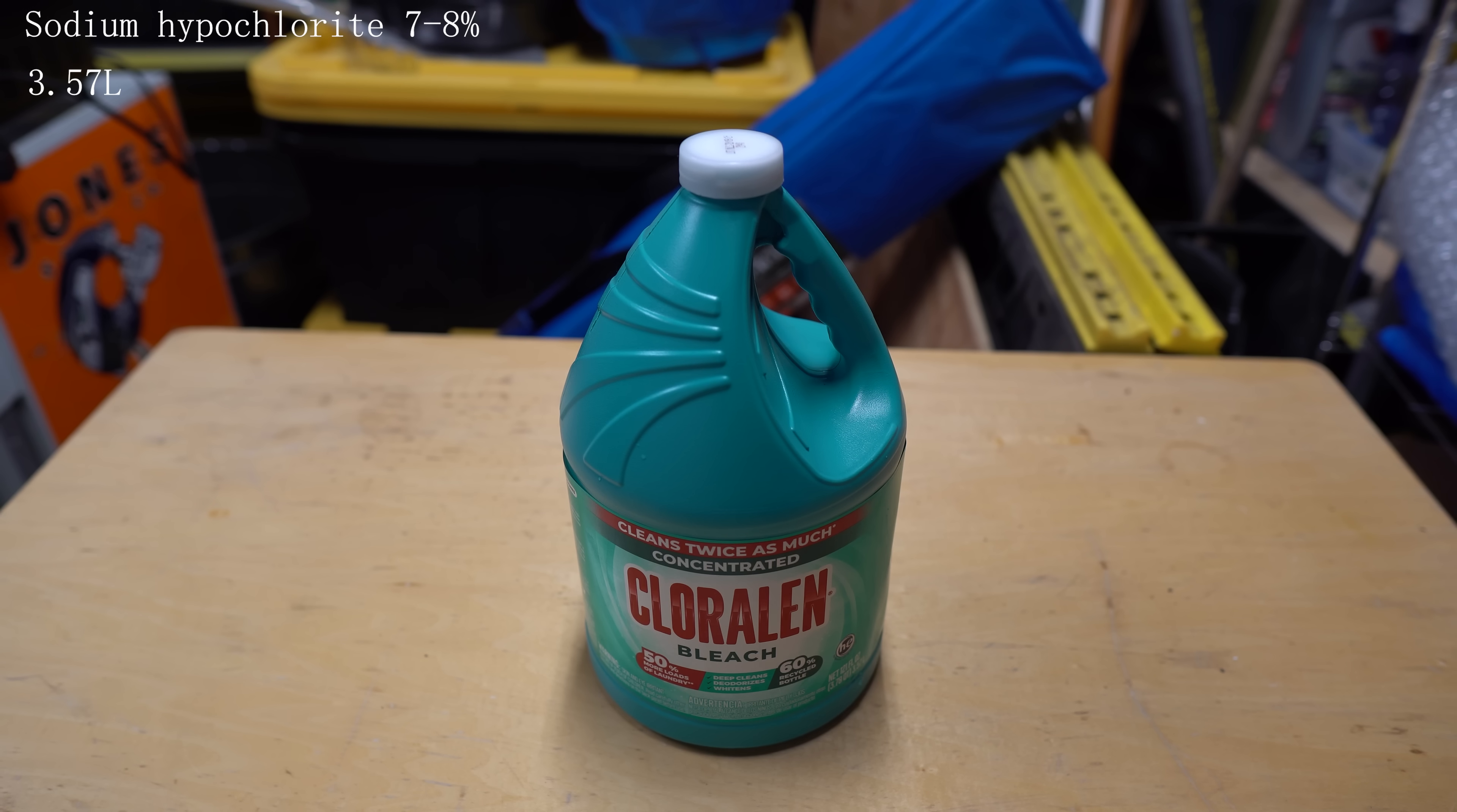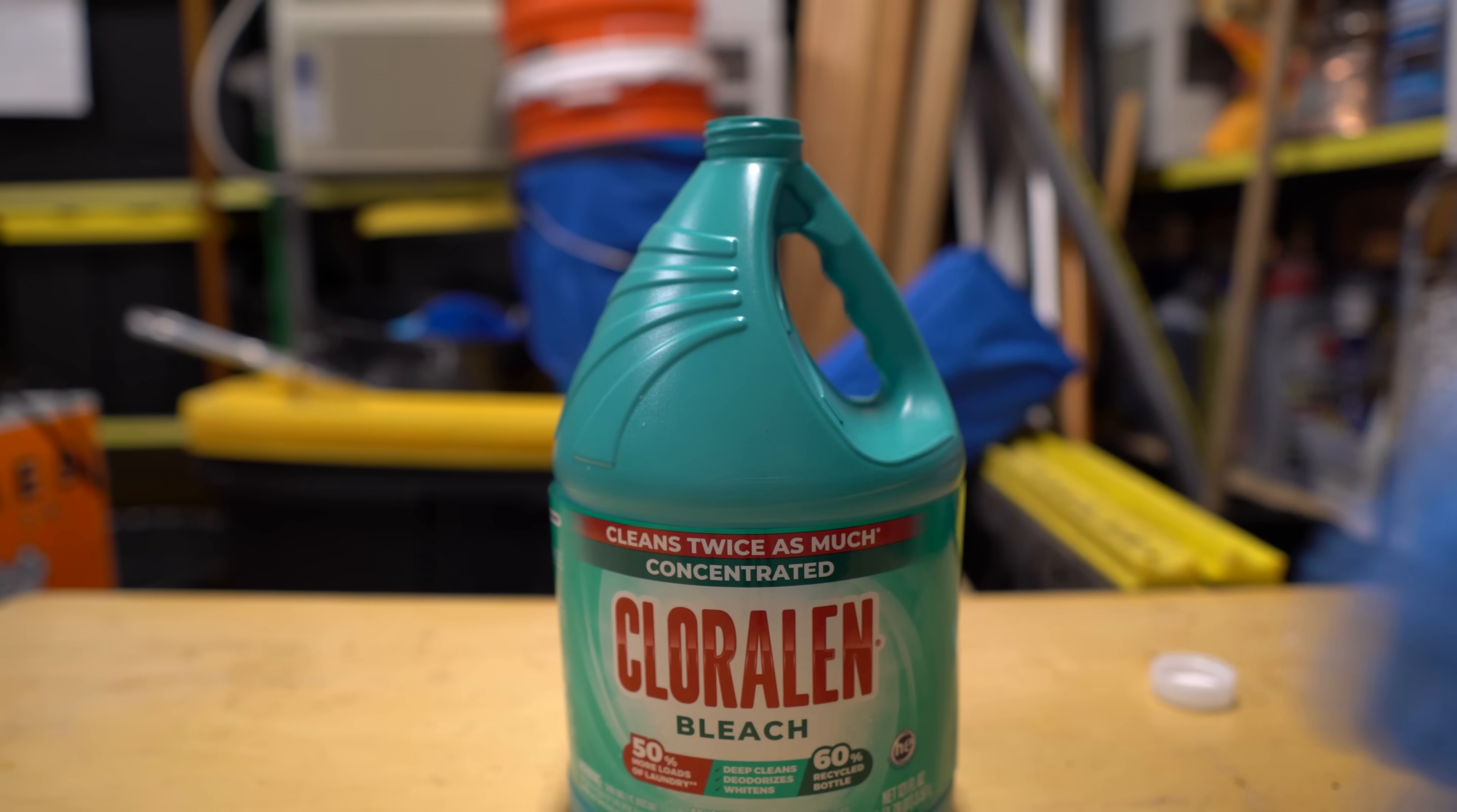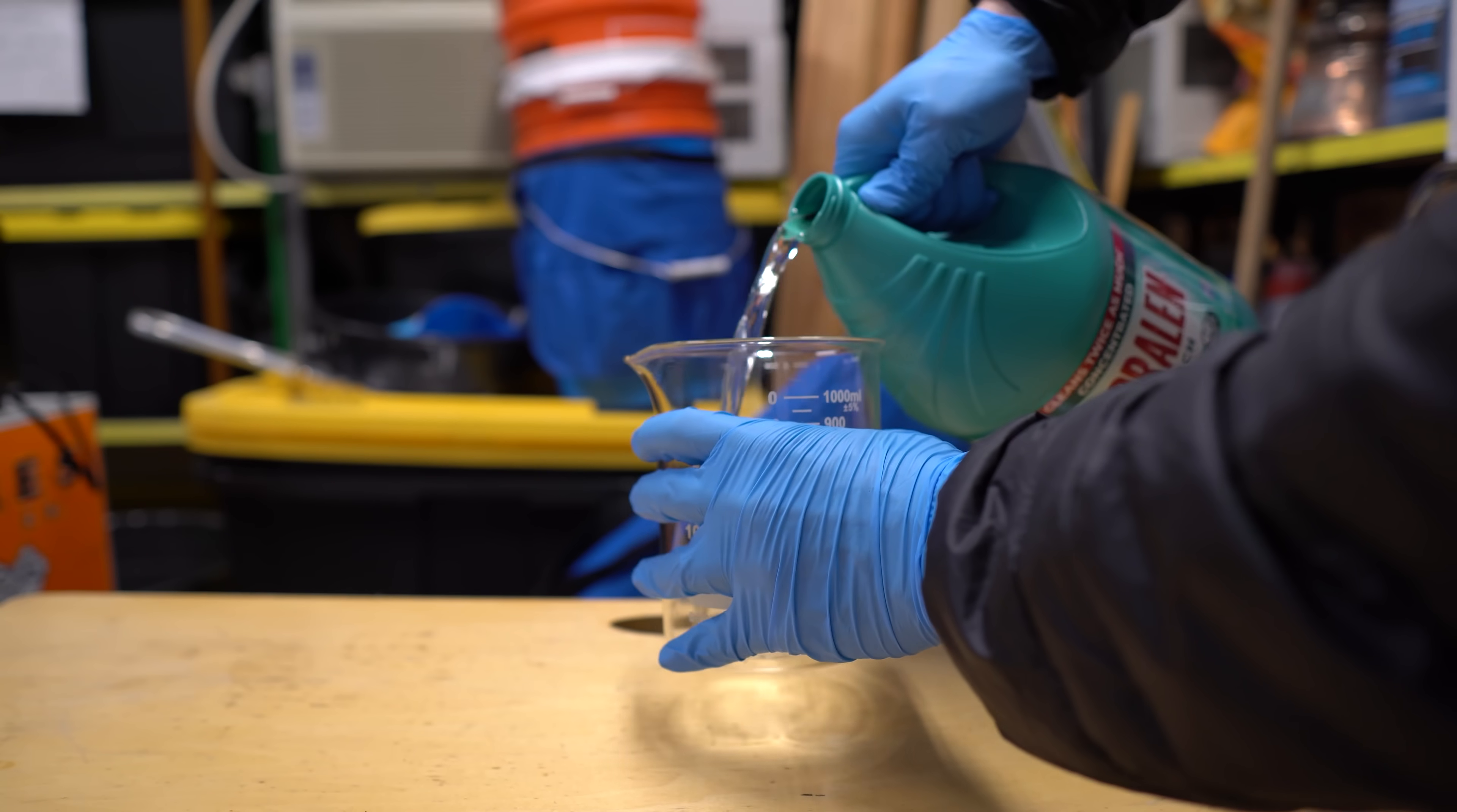You'll need some bleach, and you'll want to get a pretty concentrated solution. The one that I have has 7-8% sodium hypochlorite, which I checked off the SDS on the company's website. You're going to want to dump out about 100-150ml of the bleach so you have room to add the acetone and so that you can actually mix around the mixture.